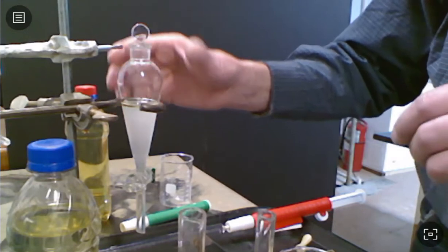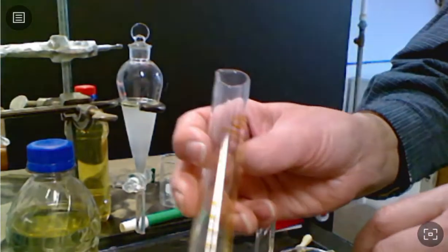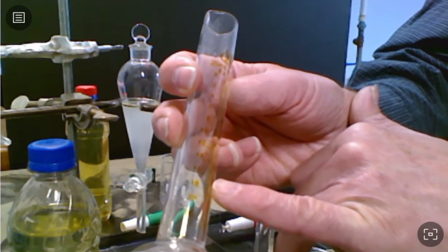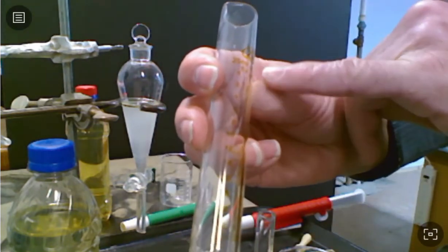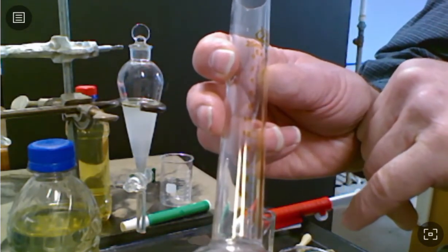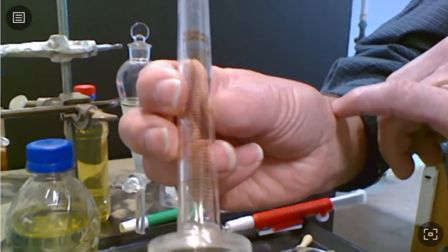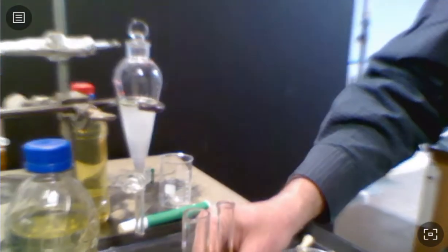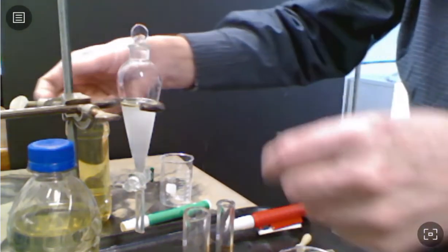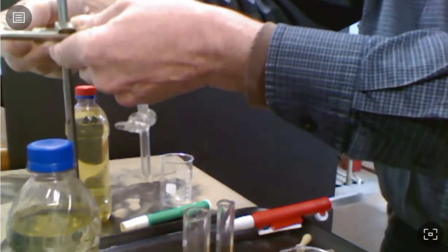In order to do that, I'm going to put a graduated cylinder. Now remember that we started with only 10 milliliters in the water layer. But now, because a lot of that ethanol has moved to it, we're going to look and see the volume. This is a 25 mil graduated cylinder. We'll just look and see what volume is in the water layer. And then after that's said and done, we'll collect the gasoline layer in the 10 mil graduated cylinder and see what the volume of that is. All right, so I'm going to reorient this and then we'll pull that off. To make room for my graduated cylinder, I'm going to lift up my funnel.